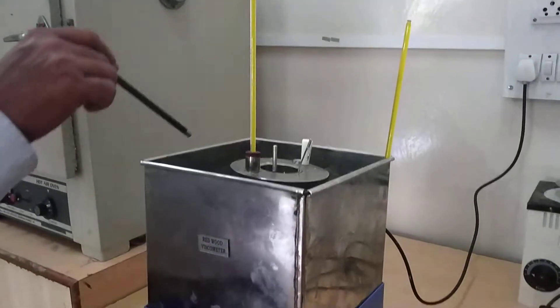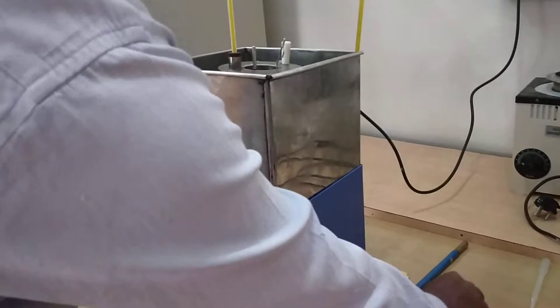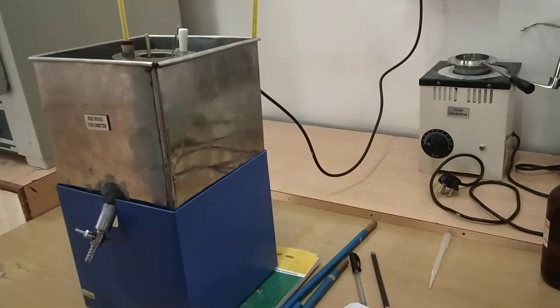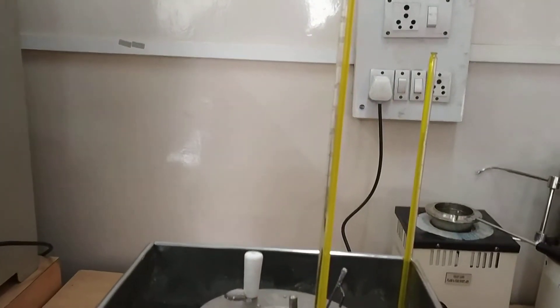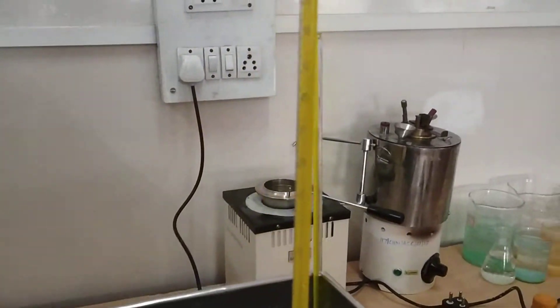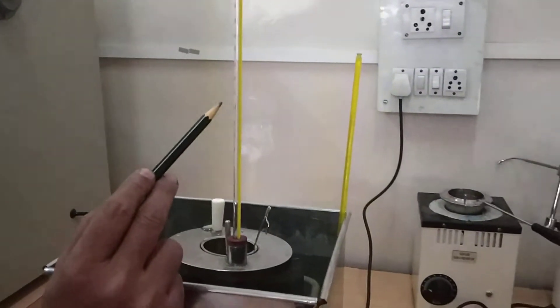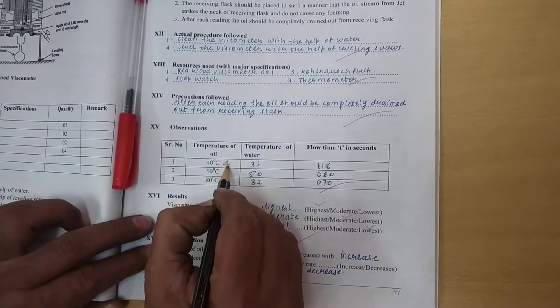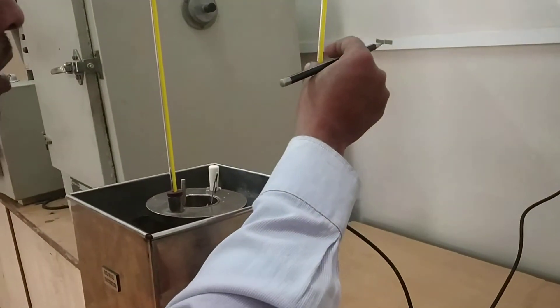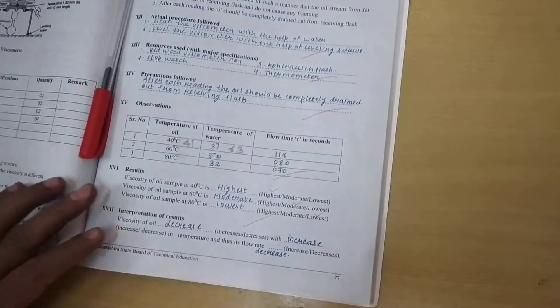Water gets heated. After some time the oil gets heated from the water — the oil is not directly heated. You have to check at 40 degrees centigrade temperature of oil. Here the temperature is currently 30 degrees, going on increasing slowly. Now the temperature of oil is near about 41 degrees centigrade. Note the reading: oil temperature is 41. What is the water temperature? Water temperature is near about 63 degrees.